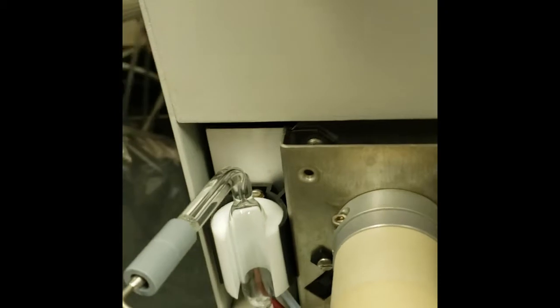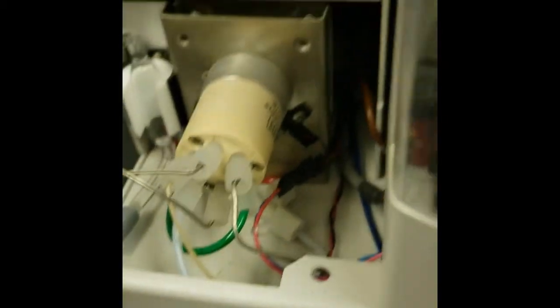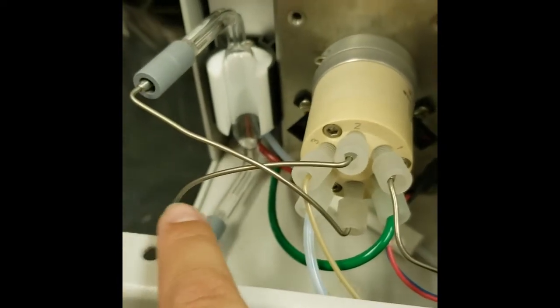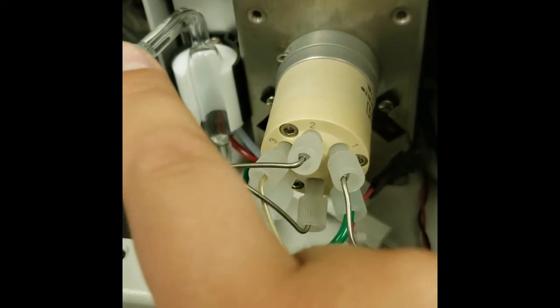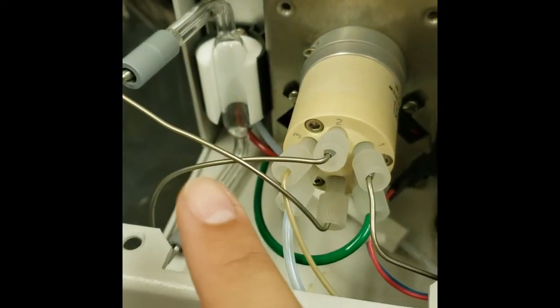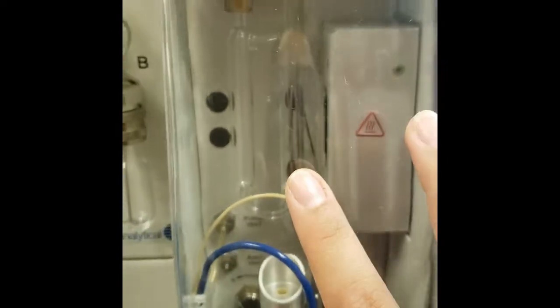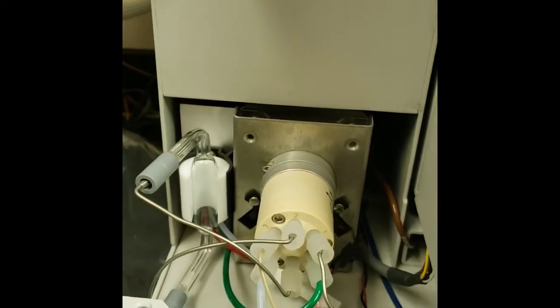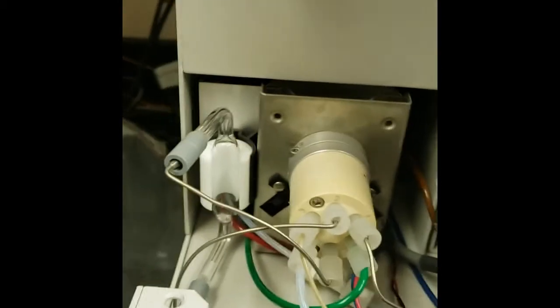And in here you can see where the sample will be extracted, and then it'll come through this metal vessel here and fill, which measures out 5 milliliters, and then sends that up to the sparge vessel here. So it extracts extra, and then the rest will go to waste. So that's how it's designed.